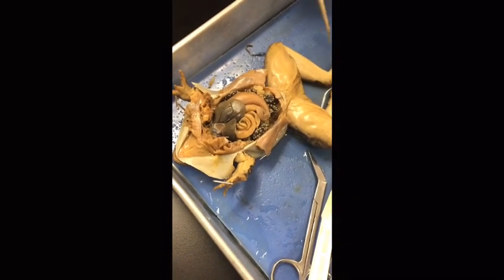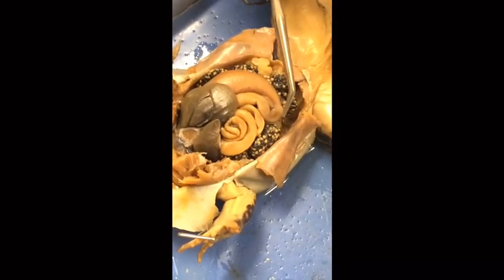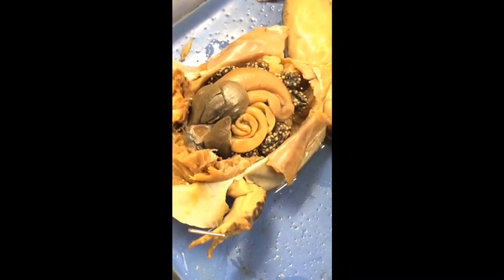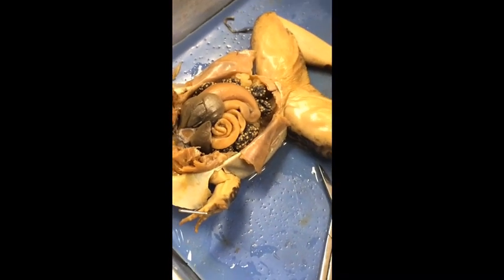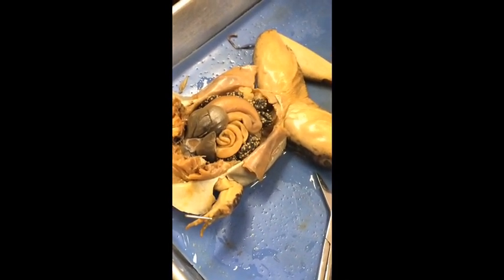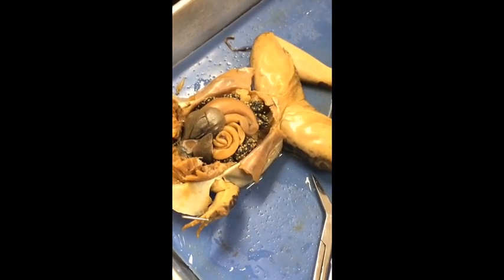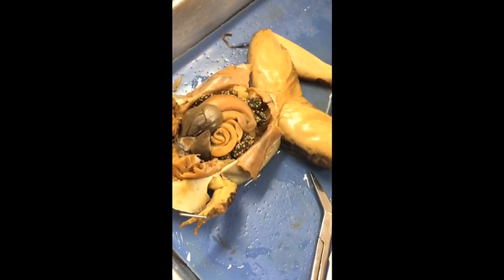Moving on to the reproductive system — this is a female, so these are the ovaries, this blackish thing, and the white things on top are the eggs. The frog does external fertilization, meaning the eggs are fertilized after being laid. The male gets on top of the female, the female releases the eggs, and the male releases sperm on top of them — this is oviparous fertilization.